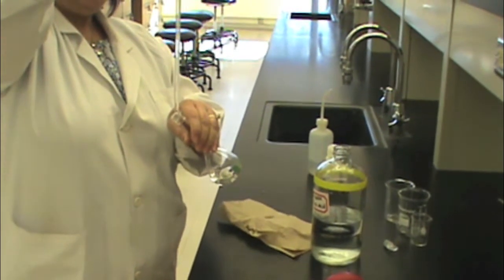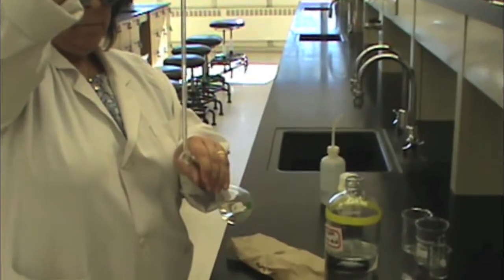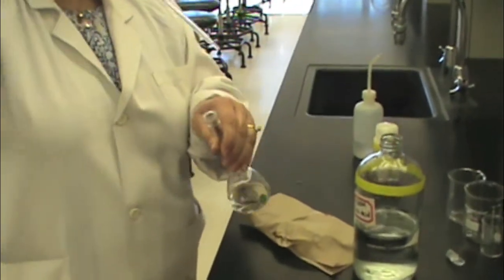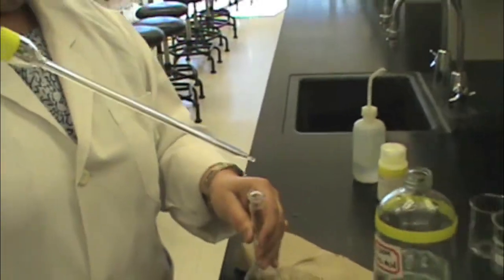Allow the liquid to flow out using gravity. Do not use any bulbs at this stage. Once the pipette has drained, make sure that you have some liquid left in the tip. This is the correct way to empty the pipette.